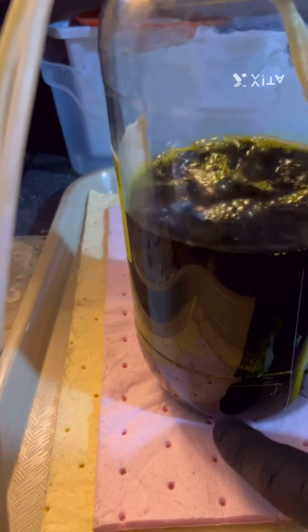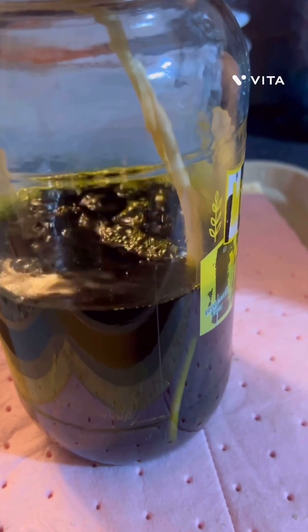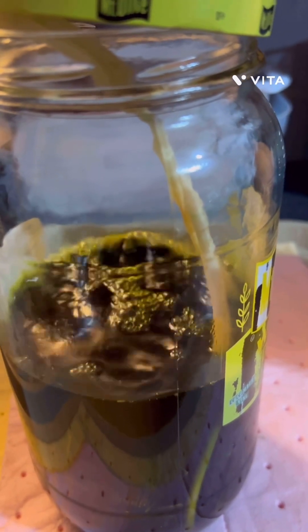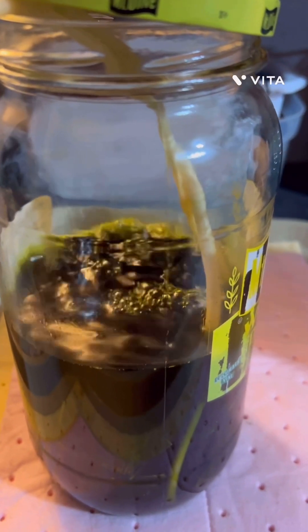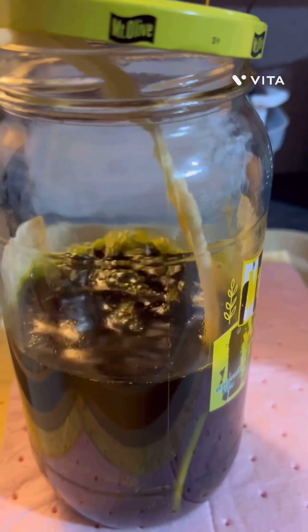The foils will be on the bottom here hopefully. We'll probably have to make a strainer-type device that allows the foils to go through but retains the chips, and then wash and run through the bleach and hydrochloric acid. We'll drop with SMB and then clean them up. But that's my acid peroxide setup.